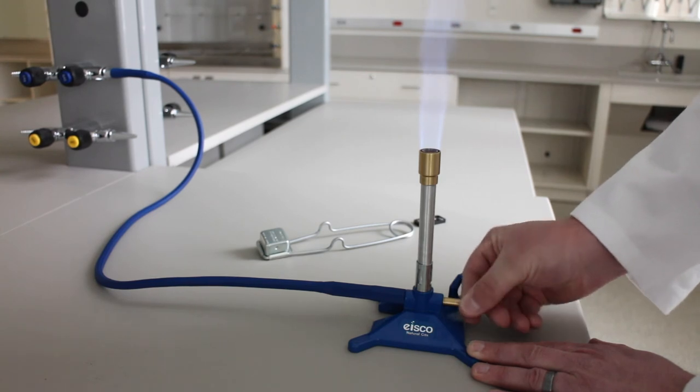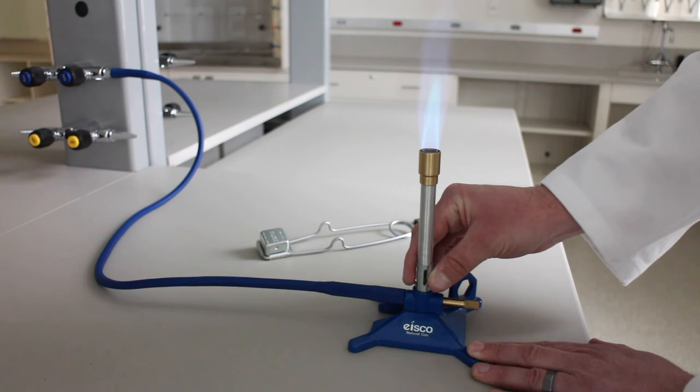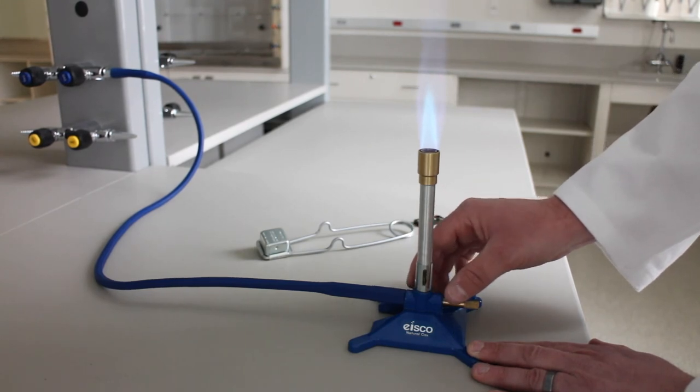Similarly, as we increase the gas flow, the flame gets larger and we can modulate the air intake to give us a double blue cone flame.